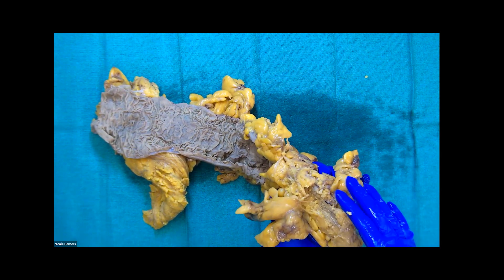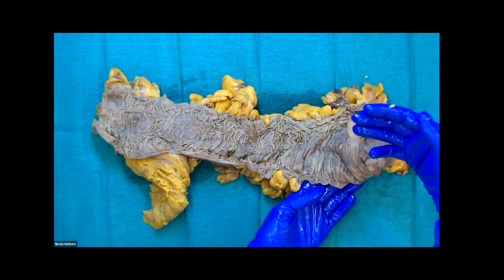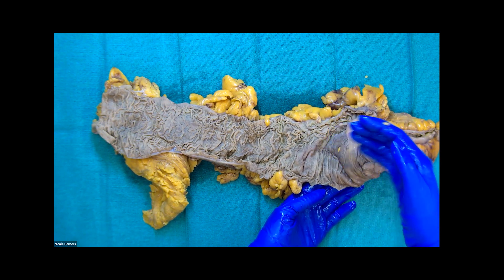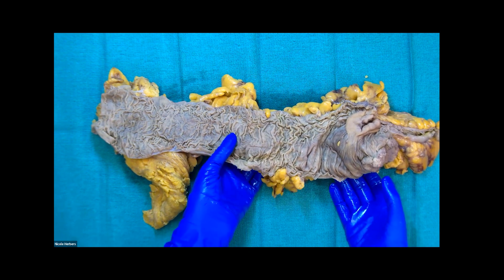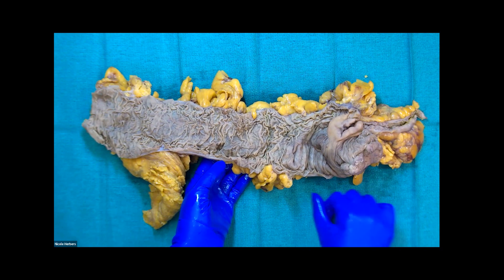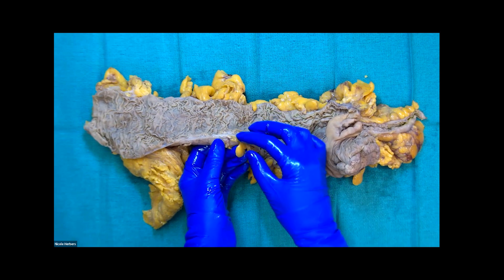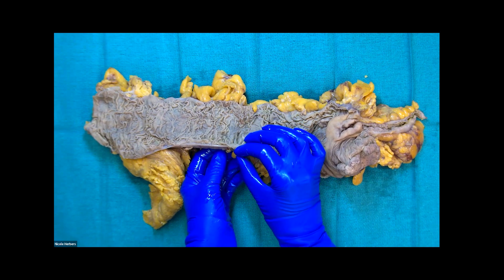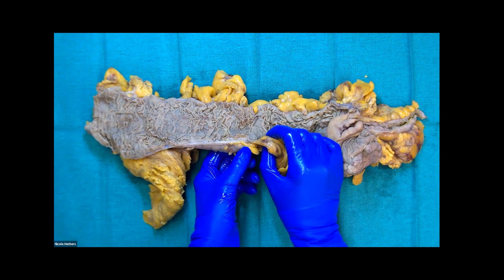I always want to avoid cutting through the side that has all of the fat on it, because that's where my radial margin will be. And if I'm cutting through my serosa and I feel that the mass is right where I'm going to have to cut, I want to put some ink over top of that before I cut through. Just so that when I'm grossing the specimen, it's easy to identify where the actual serosa is versus where I made that cut, because it can be difficult to identify the true serosa grossly once you've cut through.